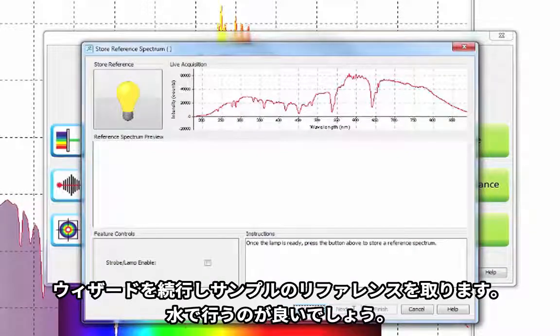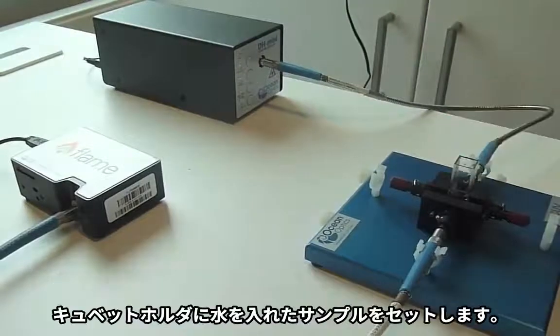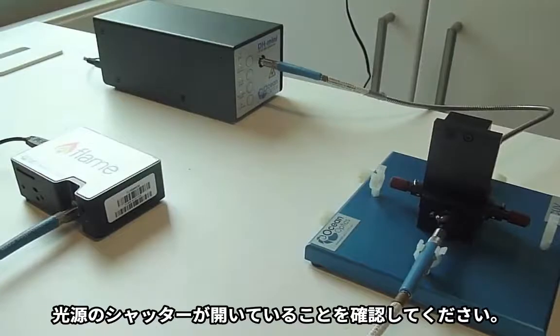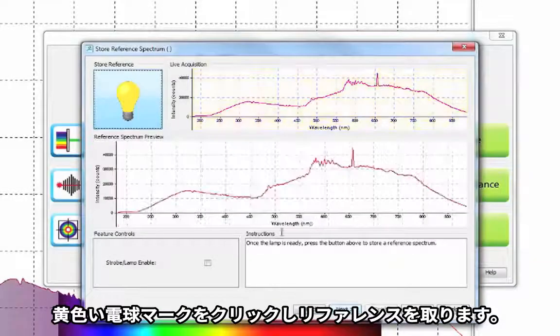To do this, you must use your reference sample. Water is often a good choice. Place the water sample in the cuvette holder. Ensure that your light source is on with the shutter open. Then click the yellow bulb to take a reference.